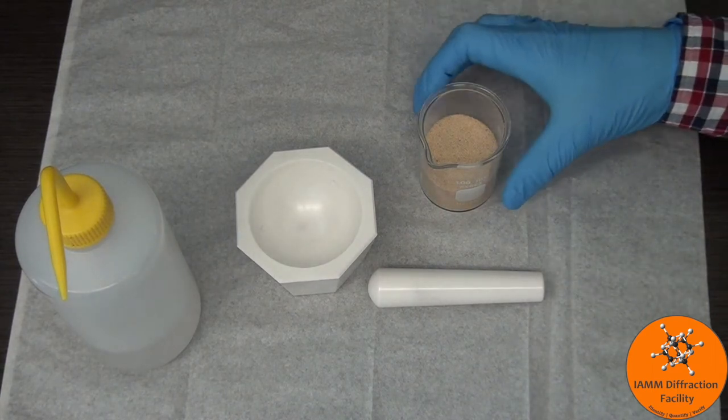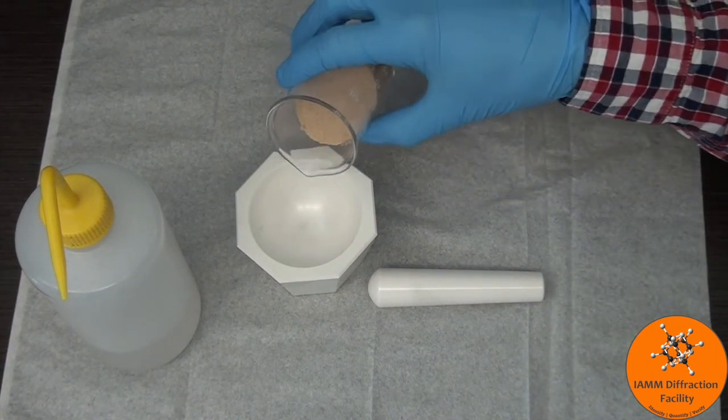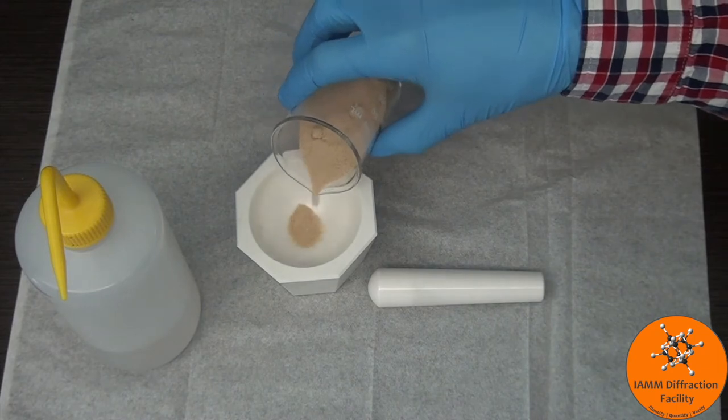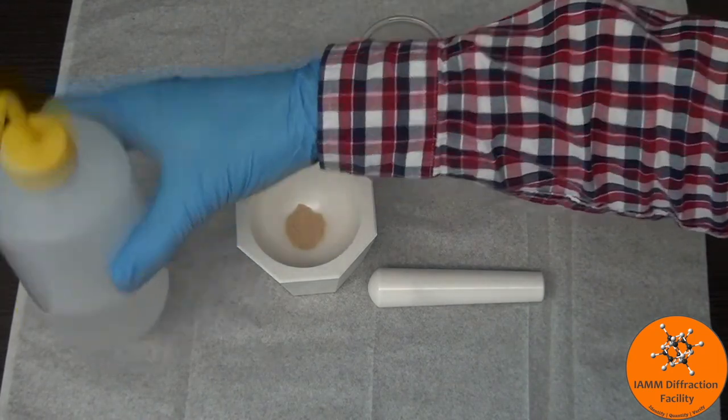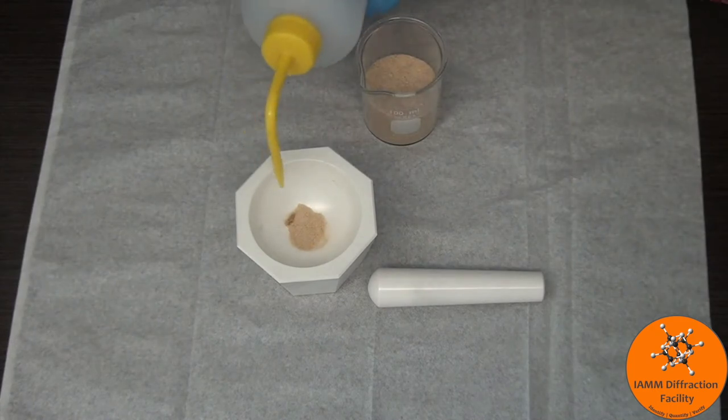There really isn't much to this. You just pour in a little bit of sand. You don't need too much. And then a little bit of isopropanol.